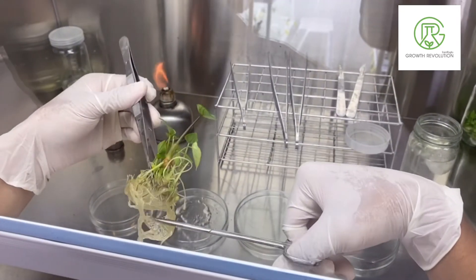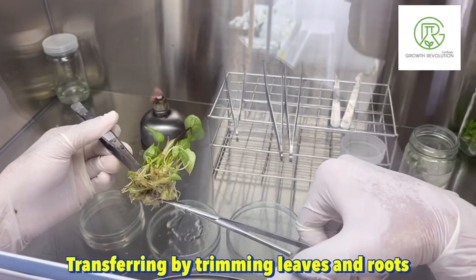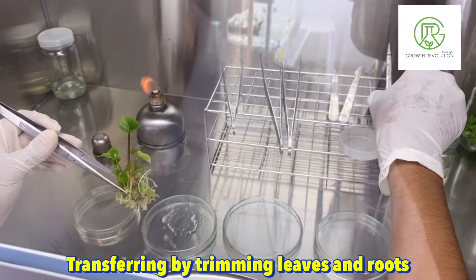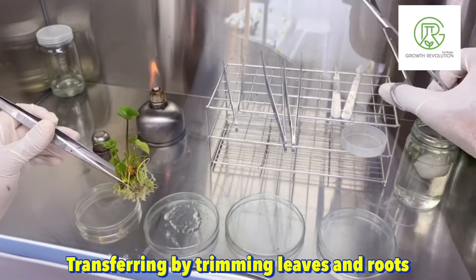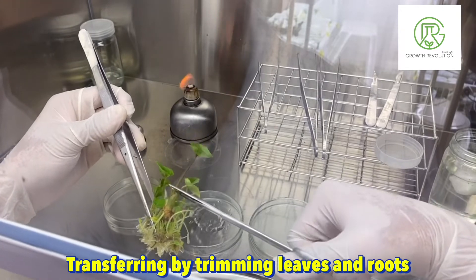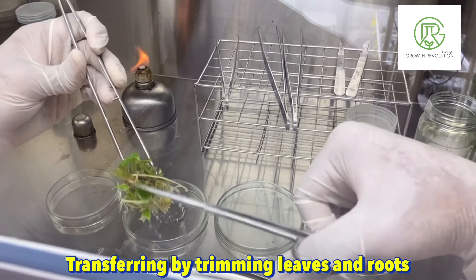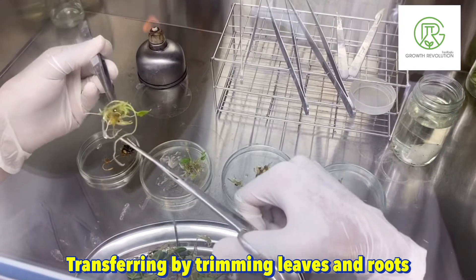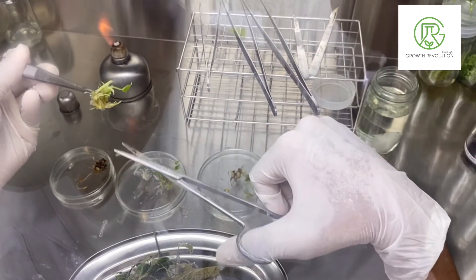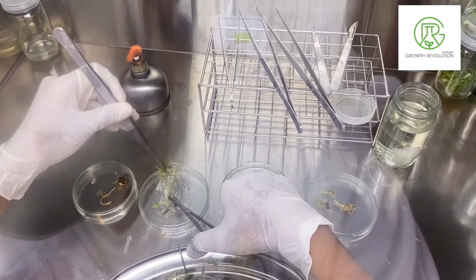The second technique is to trim both roots and leaves. This technique is suitable for bigger plants like Monstera, Philodendron, or Alocasia, because they have a bigger size. Plants where we cut both leaf and root will produce more tips, so I really recommend cutting both. You can cut only the root if you prefer, but it takes longer and produces fewer tips.